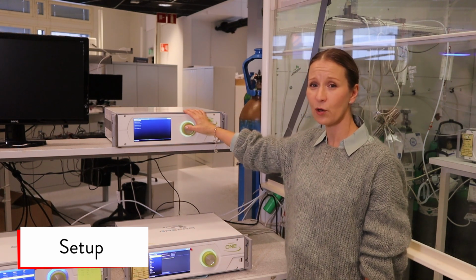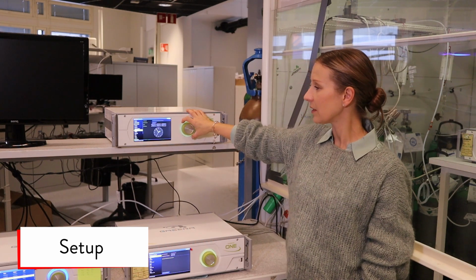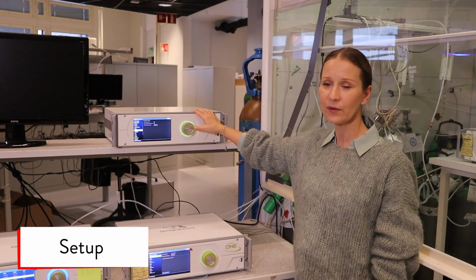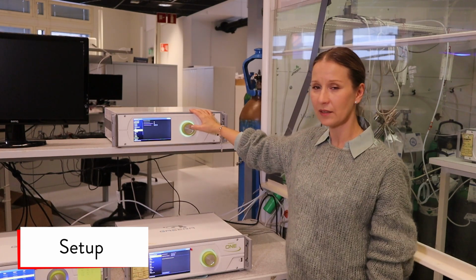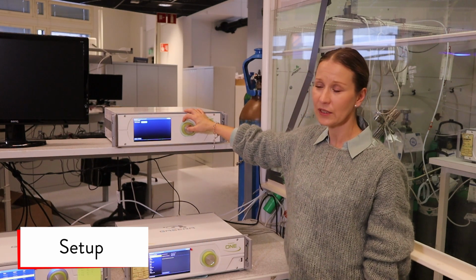Our device can be operated through AK protocol. The clock is set for the time zone. Display, you can enable the screensaver, which means that after the set idle time, the screensaver will appear on the screen. Language can be selected from the language settings.